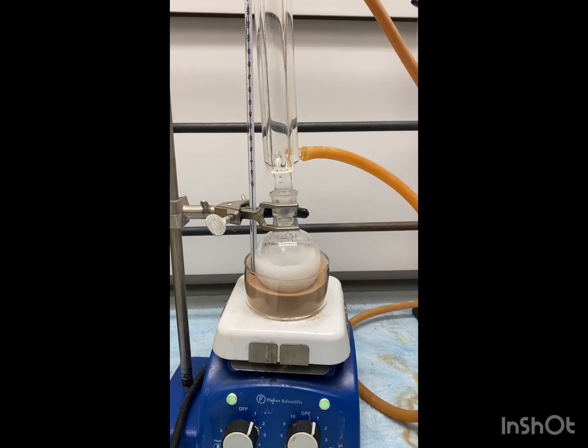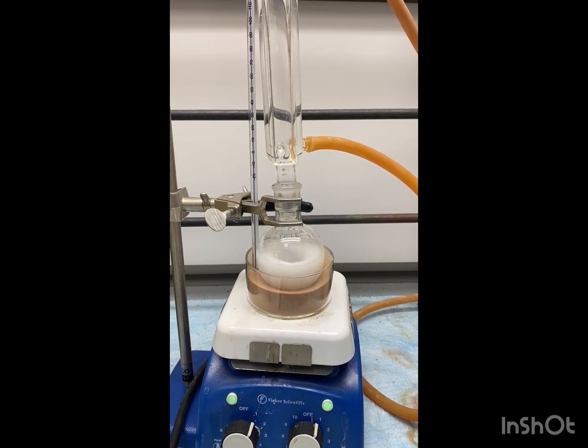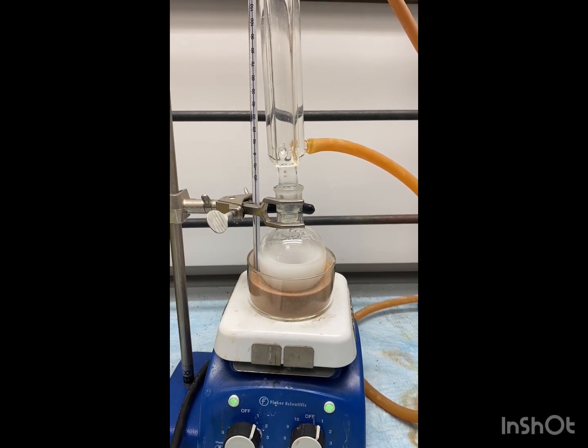Now that we've refluxed for 15 minutes, we're going to go ahead and take it off the heat and let it cool, just air cool, until it's room temp.